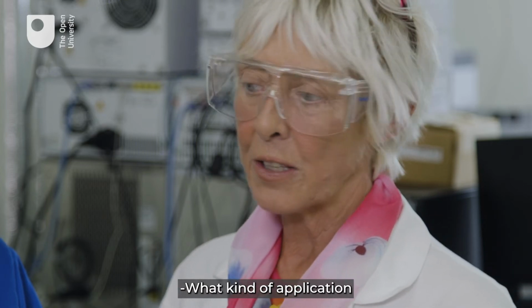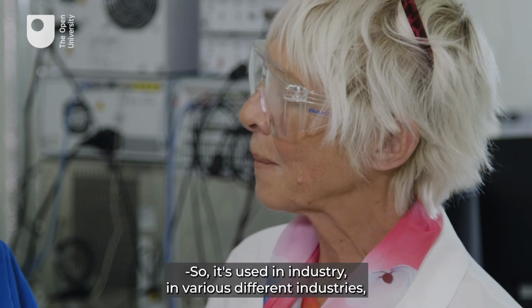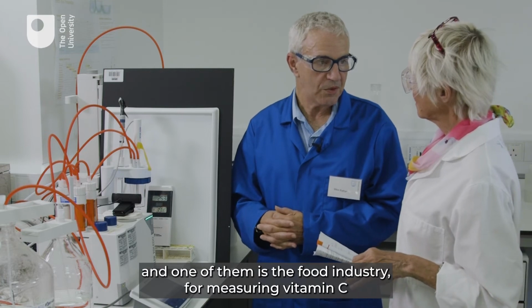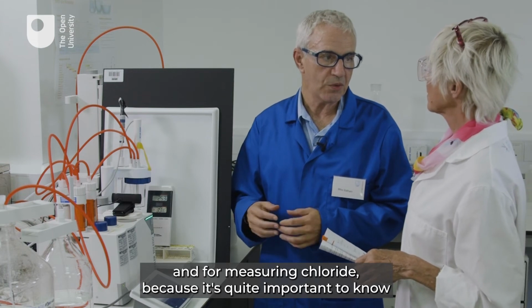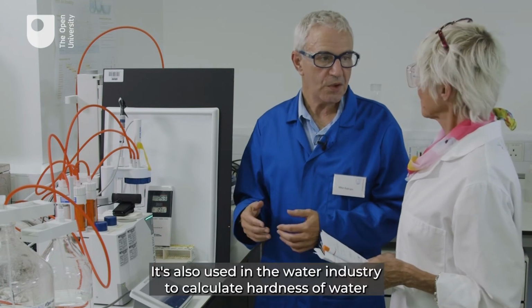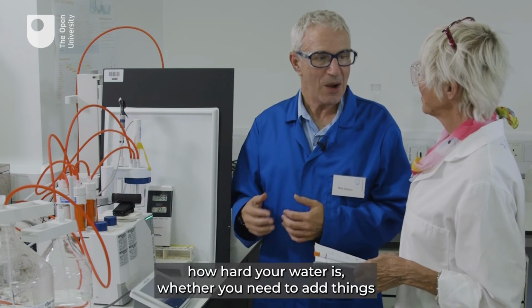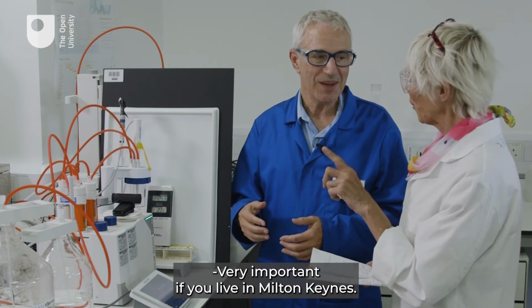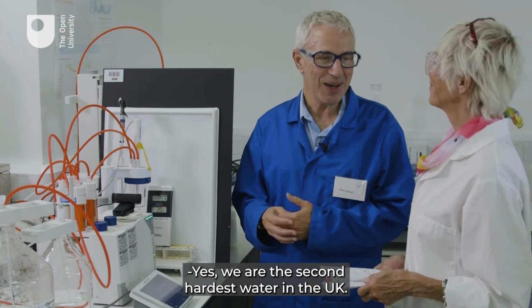What kind of application would this experiment have, for example, in the real world? So it's used in various different industries, and one of them is the food industry for measuring vitamin C and for measuring chloride, because it's quite important to know the salt content of your food. It's also used in the water industry to calculate hardness of water, because you need to know how hard your water is, whether you need to add things to your dishwasher or to your washing machine. Very important if you live in Milton Keynes. Yes, we are the second hardest water in the UK.